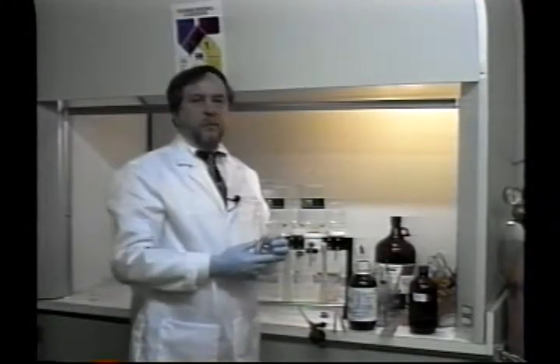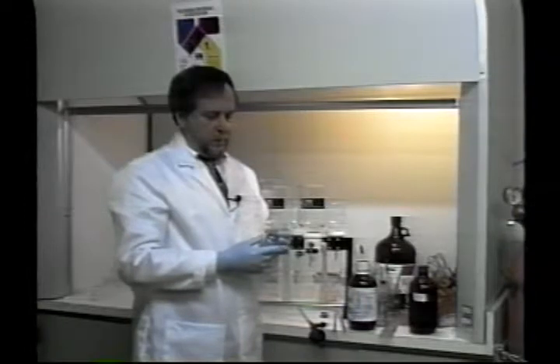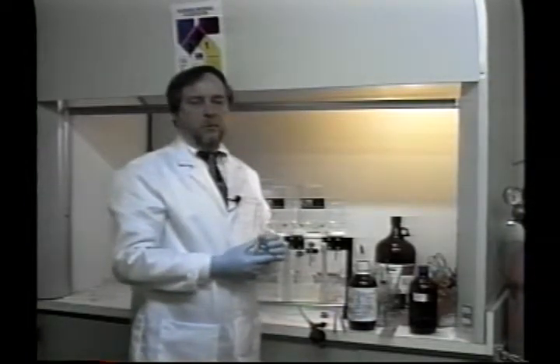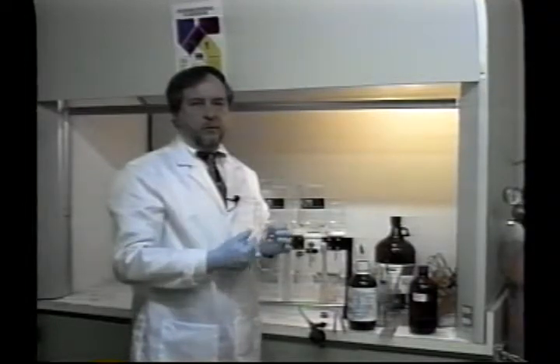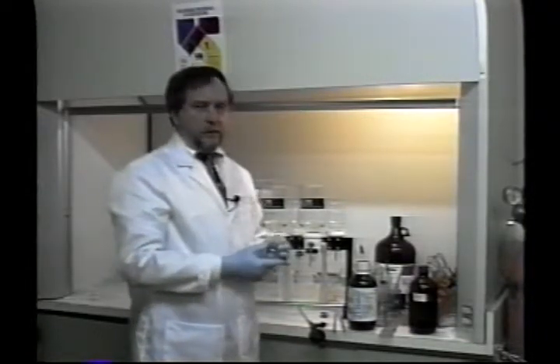Methods 525.2, you would evaporate most of this solvent down and do a gas chromatograph mass spectrometry analysis. Other methods, you might evaporate this down or do a solvent exchange and perform a gas chromatograph electron capture detector analysis. So it really depends upon what particular method you're following as to what you could do with this final step.